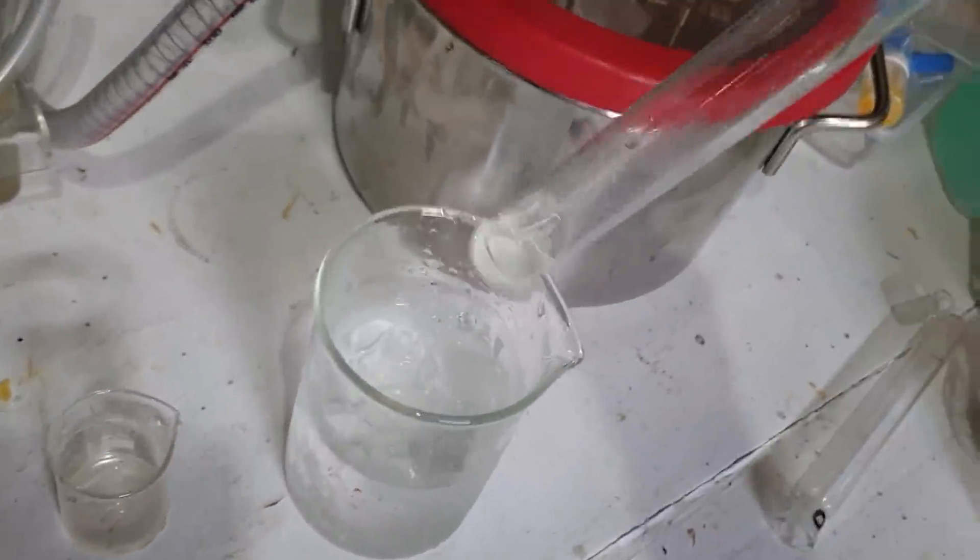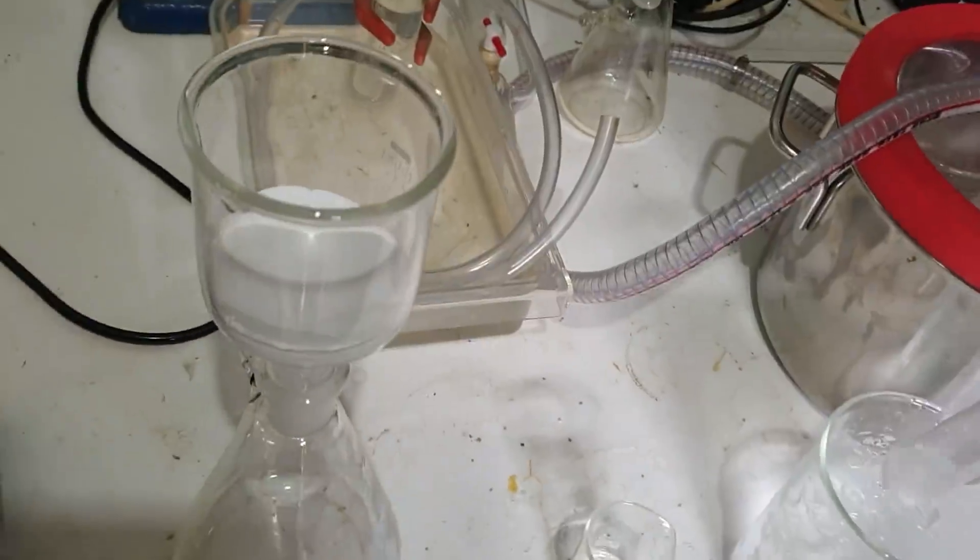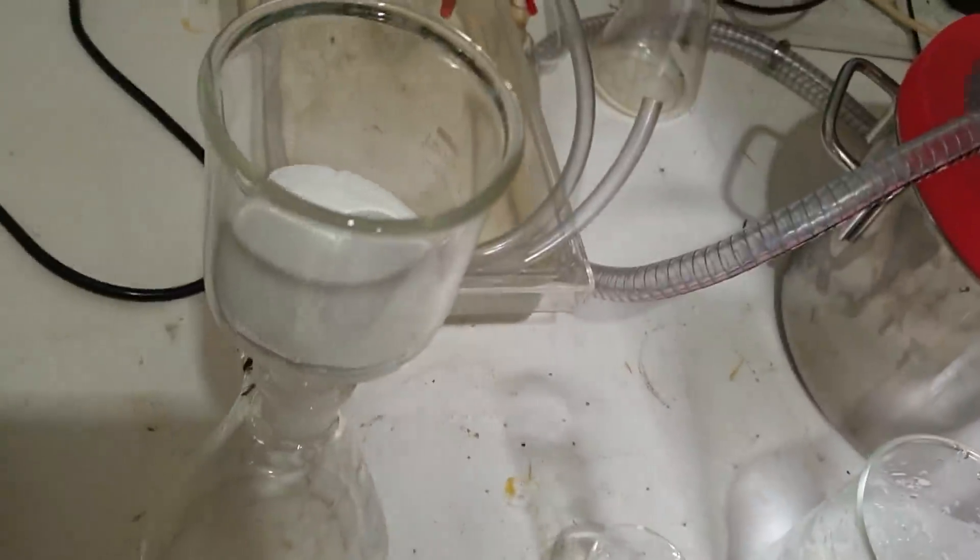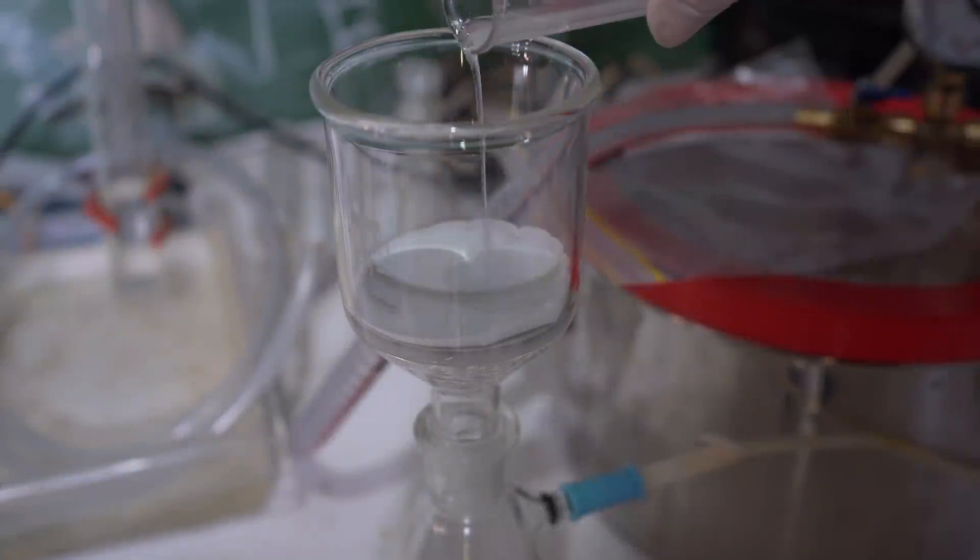All right, I've taken off the excess nitric acid and just put it in a bit of distilled water. It's all cold, just so that it filters a little better. The nitric acid doesn't just eat through my filter paper. It's probably a bit overkill using this huge filter for this small amount of product, but I will do it and dry it out nicely.